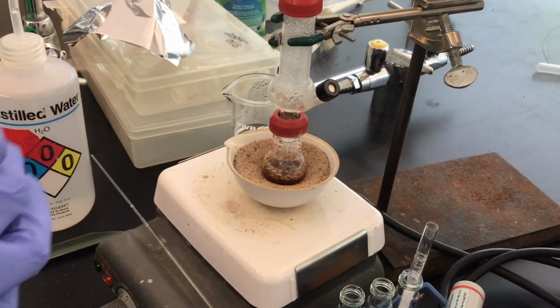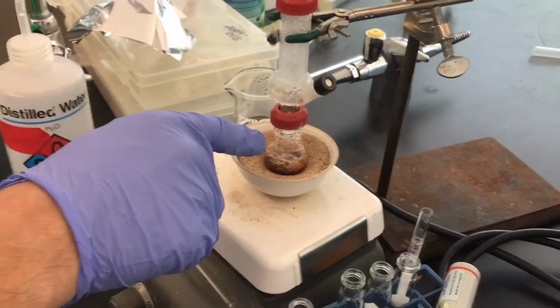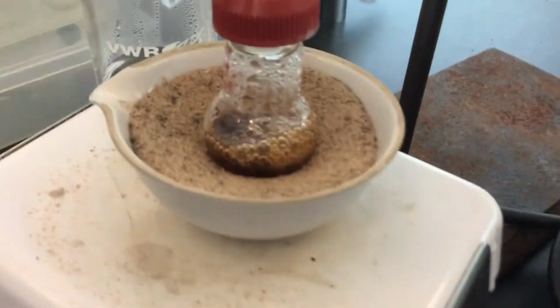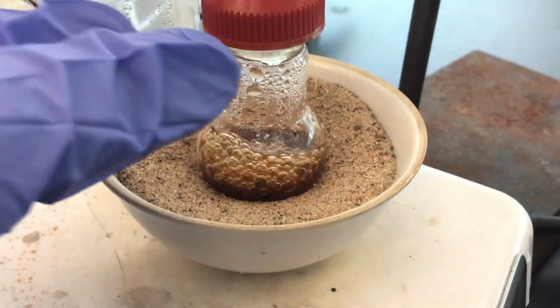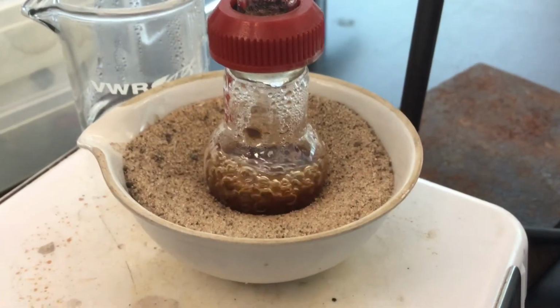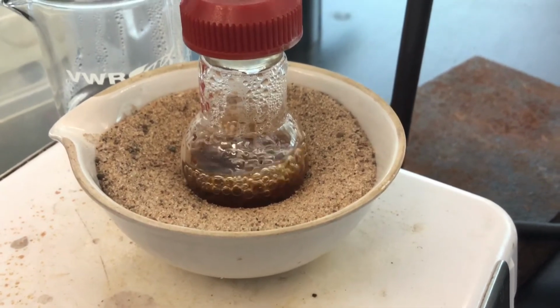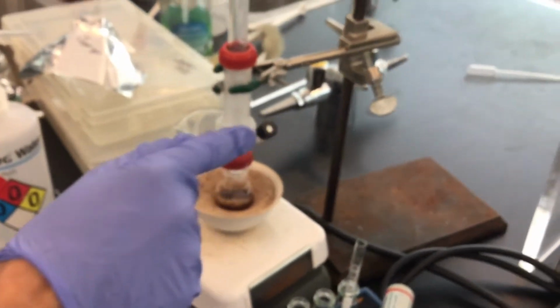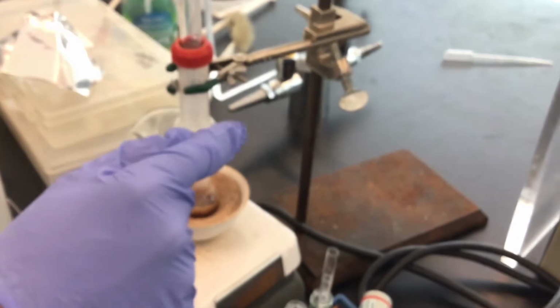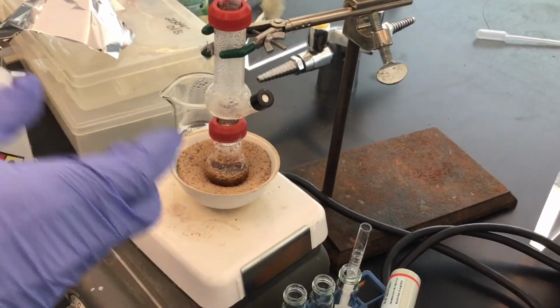Another thing that I've noticed that I had mentioned we are trying to avoid is that if you look down here really closely, you can see that the boiling is fine, but we're concerned about it bumping and then traveling upwards due to the fact that it's sort of soapy at this point. You can look up saponin in natural products that we're trying to avoid here. And so I've noticed that it happens when I unscrew this. At the most, it occurs when I unscrew this, and then there's some change in pressure in there.